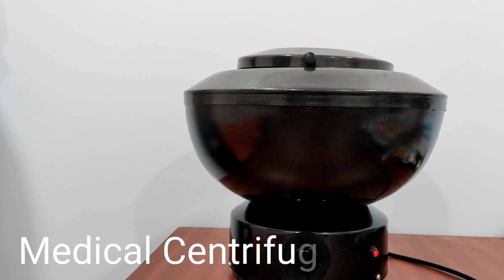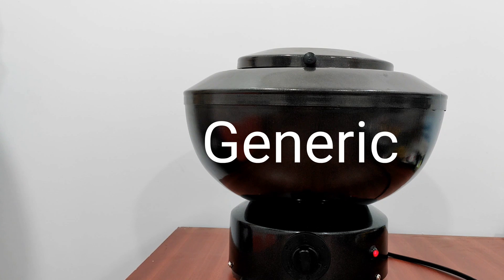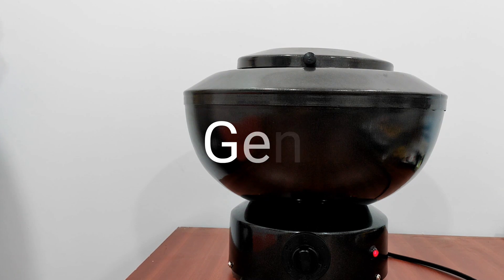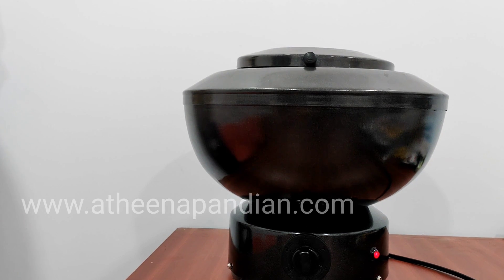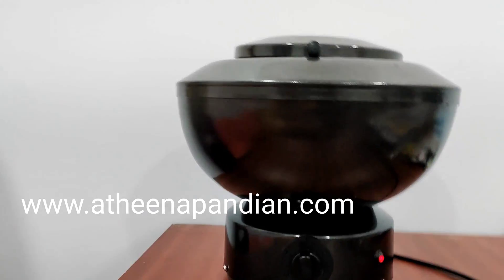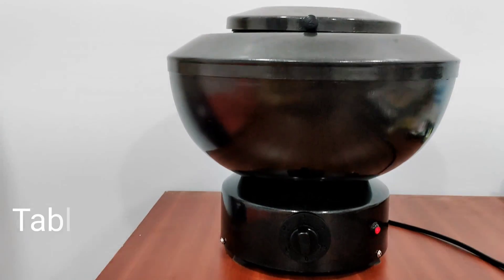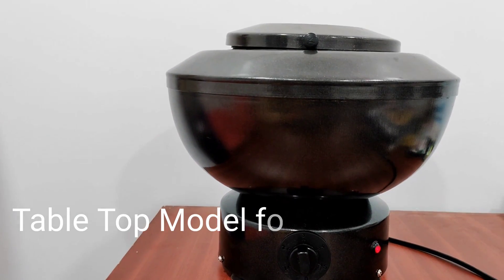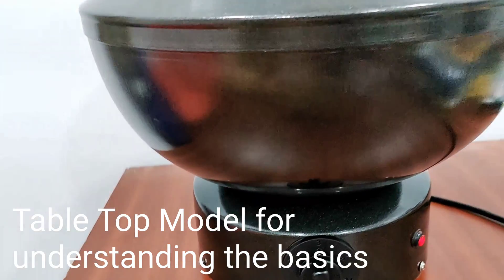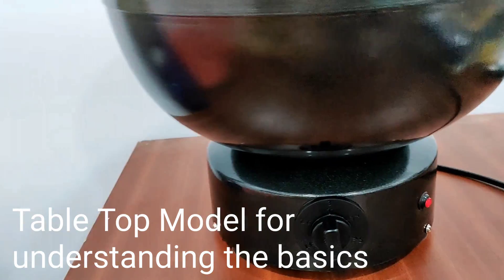Now we are going to see the device centrifuge. The brand name of this centrifuge is Genysis. There are many different kinds of centrifuge. Now we are going to see the tabletop model of the centrifuge. The main application of the centrifuge is to separate particles based on their size and density by centrifugal force.